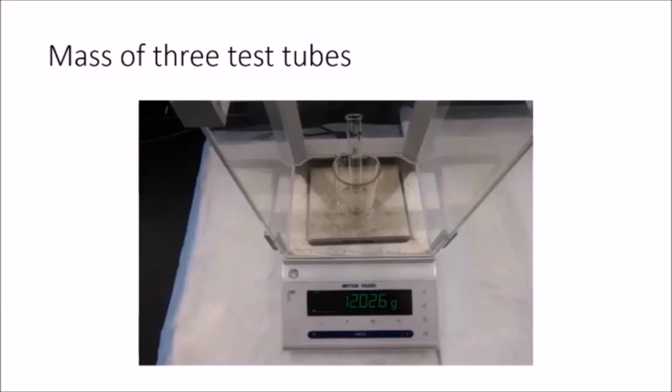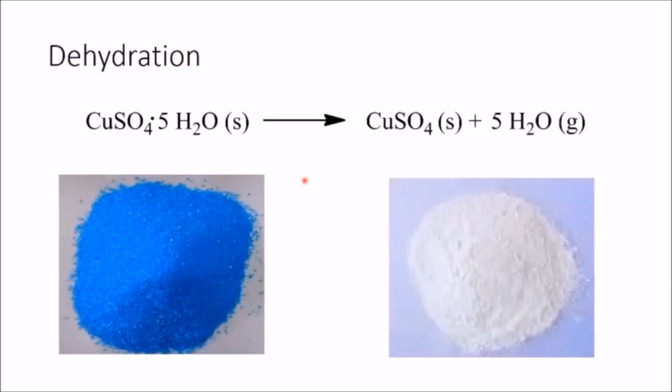You will use the mass of the empty test tube repeatedly when you do your calculations. So if this mass is not accurate, it can cause major problems in your final results. Once you have the mass of 3 clean and dry labeled test tubes, you're going to want to add approximately 0.3 grams of hydrated copper 2 sulfate to each tube.